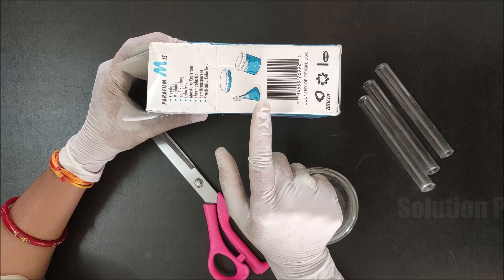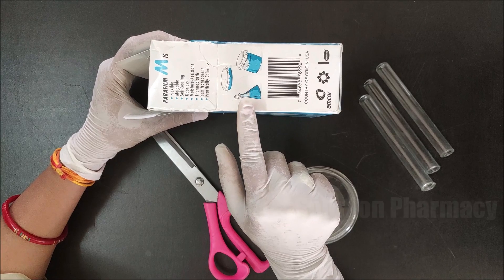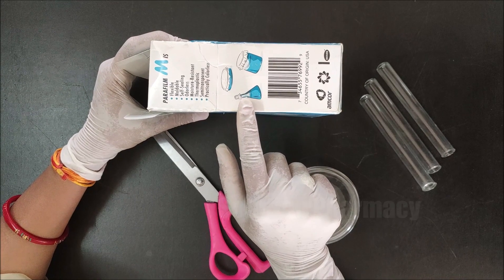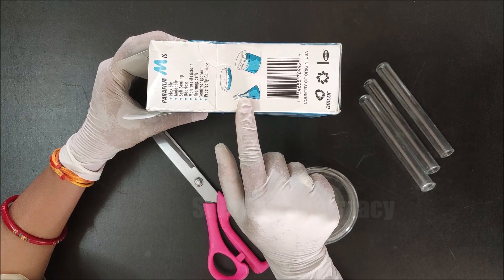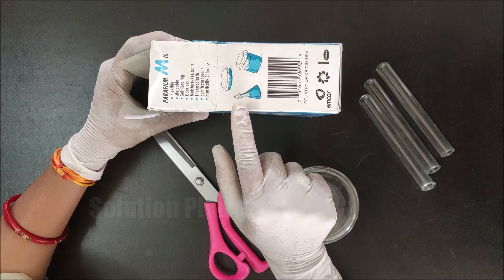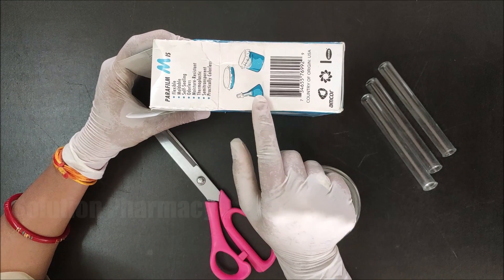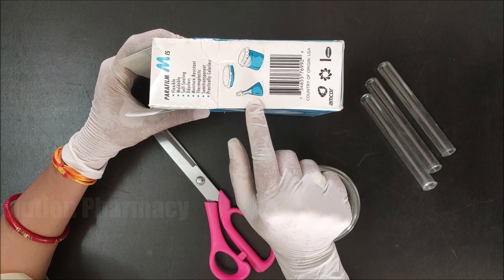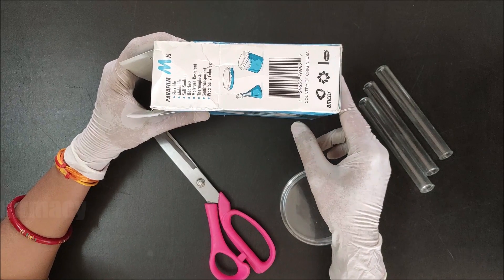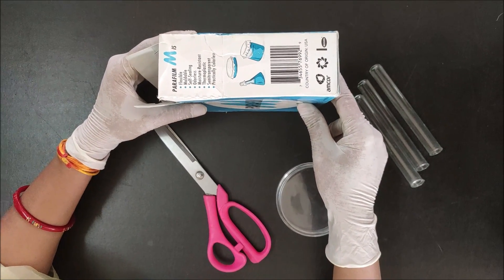Because of all these properties, parafilm is used as a plastic-type wrapping material in different labs — such as pharmaceutical labs, microbiology and biotech labs, and different research labs — to seal the opening of different containers and glassware like beakers, test tubes, conical flasks, petri dishes, and many others. Here you can see in the image how these items are sealed with parafilm.